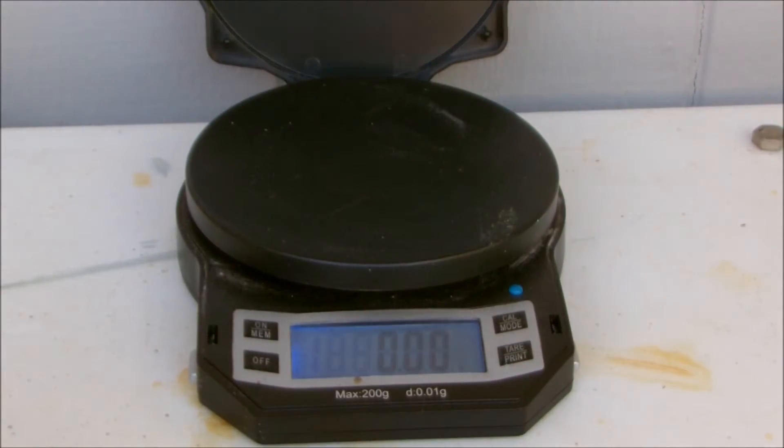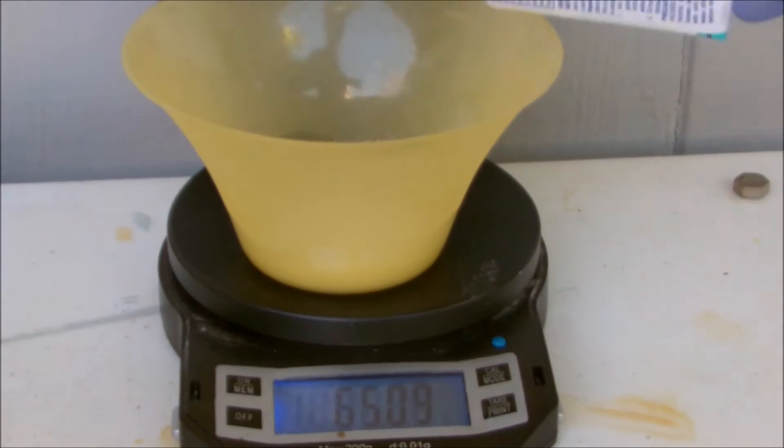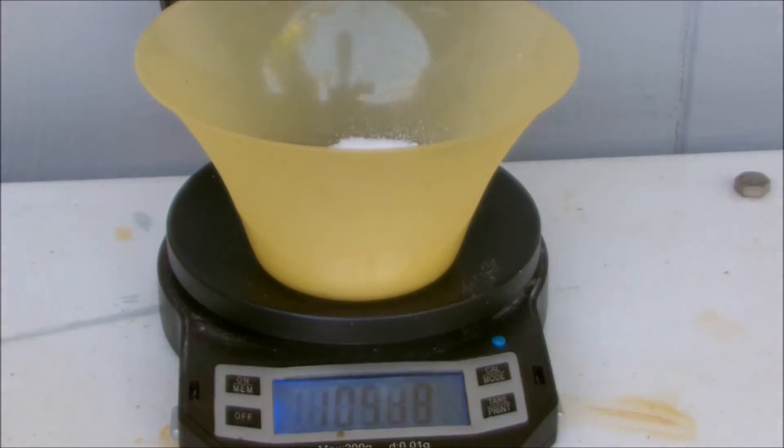The first thing to do is weigh out 102 grams of sodium bromide. There we go, that's 102.